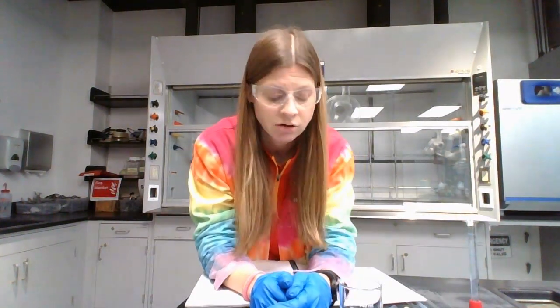So the point of this lab is we're going to figure out how much sodium is in your sample and then compare your results to the results on the label. The instrument only measures the isotope sodium-23. Again, in the theory and calculations video, we'll go through that. Lots of calculations in this lab, but let's talk through the procedure and how to do it.